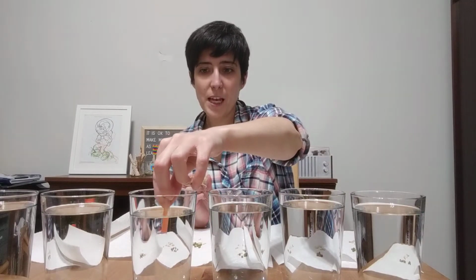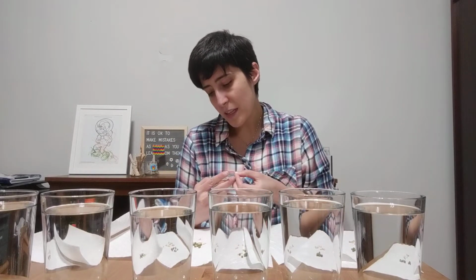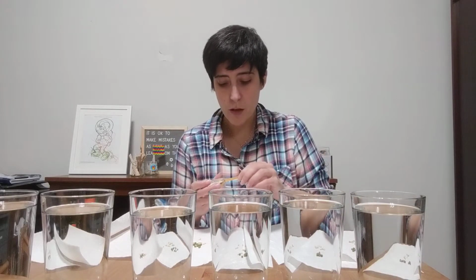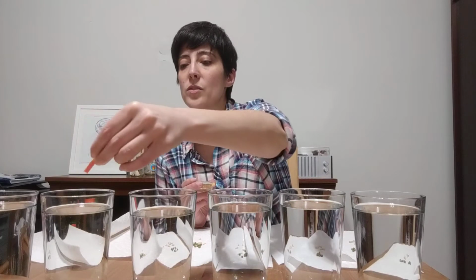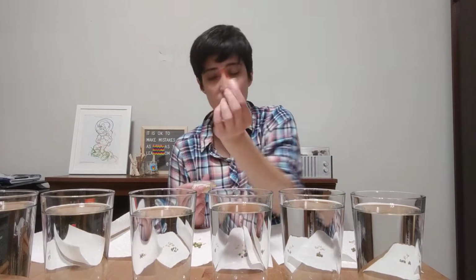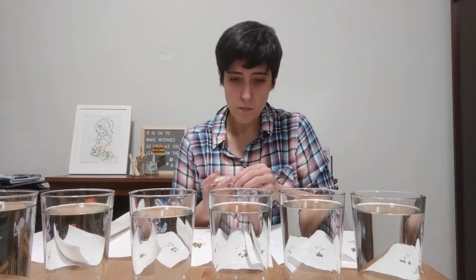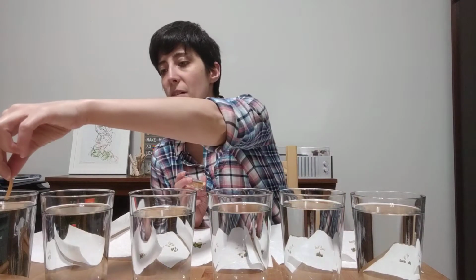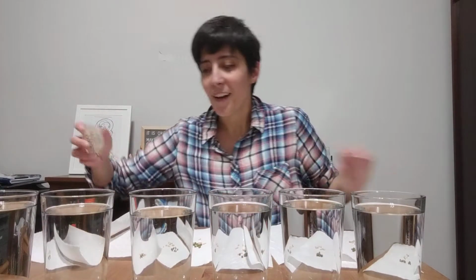This one had 50 mLs of vinegar, and that's getting much more red. Still not as red as the number 2 one here. It's probably a little bit closer to a 3 than a 2, but somewhere in the middle there. It's not as orange as the 2. Right, this one had 100 mLs of vinegar, so that one's getting pretty red. That one's about a 2. And then last, this one has 200 mLs of vinegar, and that's pretty red. That's pretty close to 2.